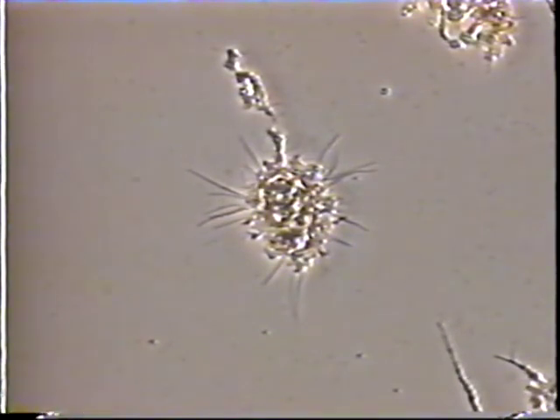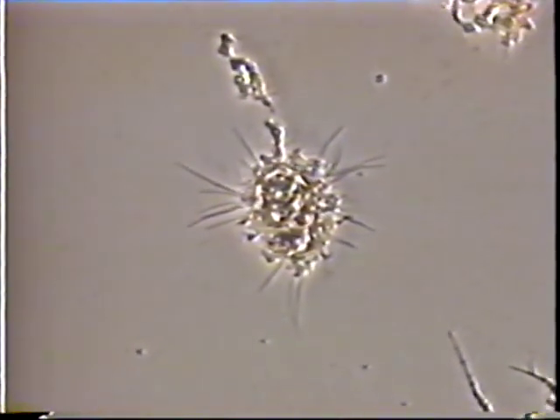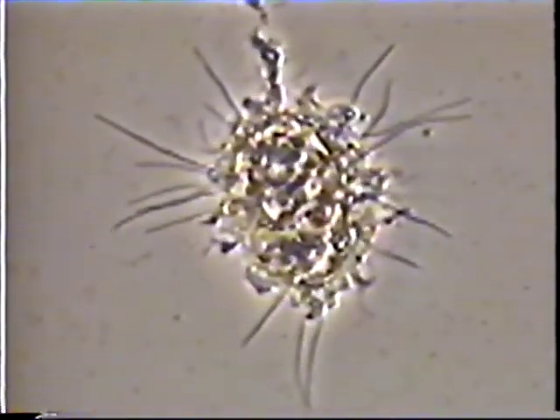Type 0411 causes interfloc bridging and sometimes dispersed filament growth. Type 0411 also has very long sausage-shaped cells and no sheath. It is Gram-negative and Neisser-negative.